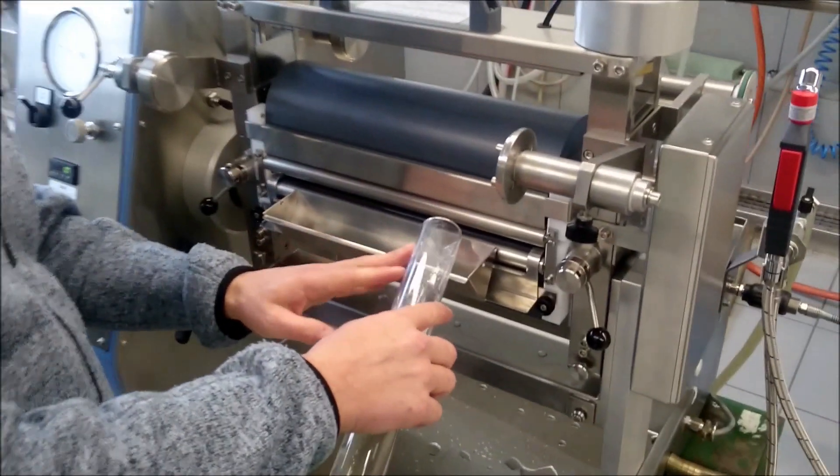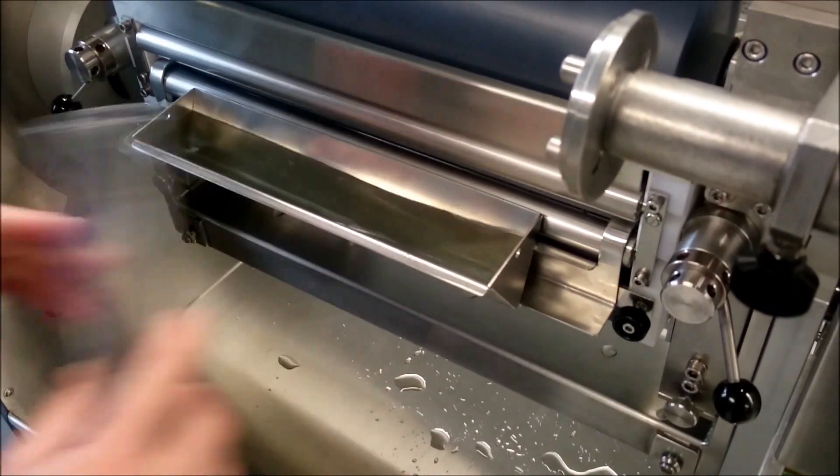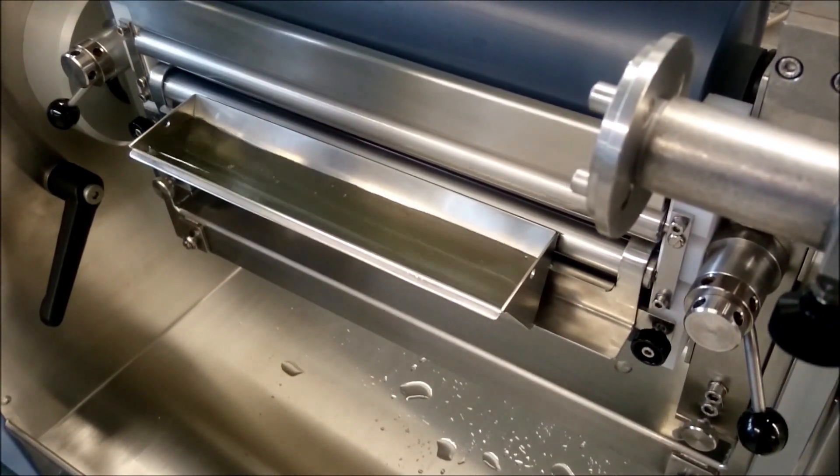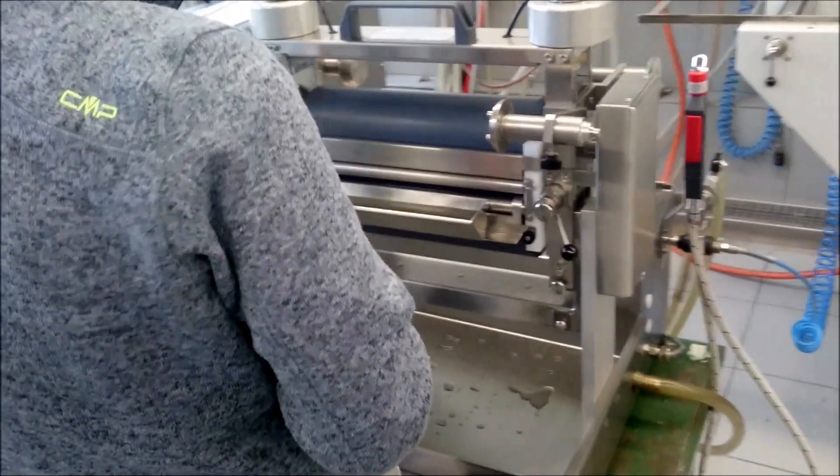Then we use again the dye liquid. Just put it in. We use larger samples. It just depends what you would like to have.